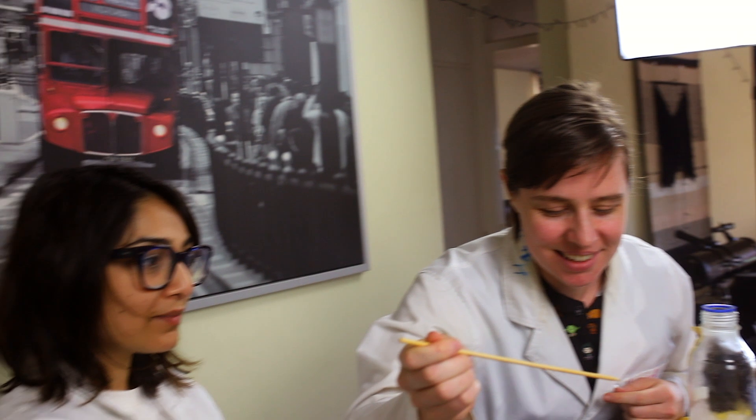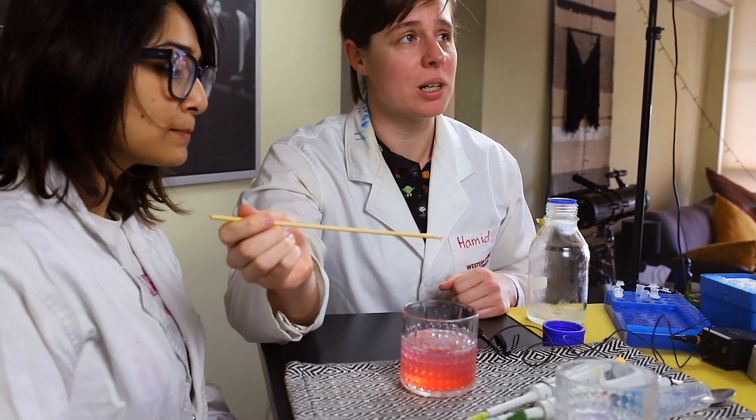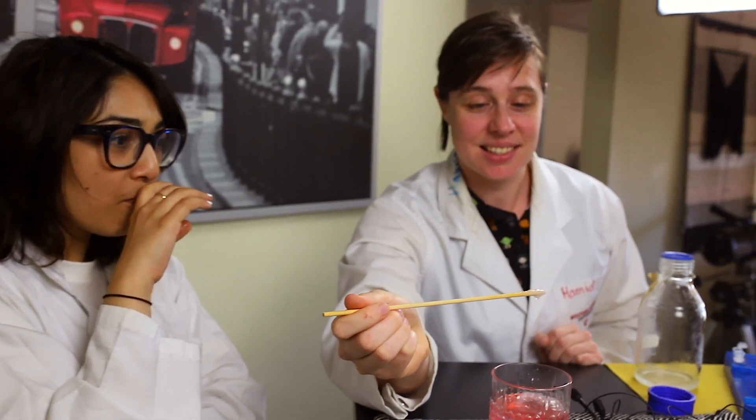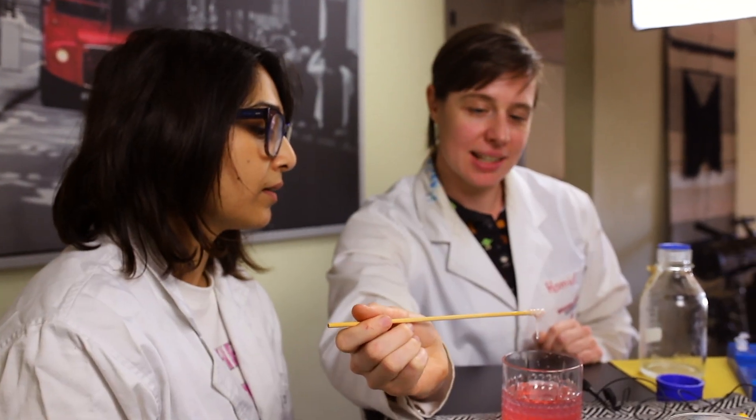So what would you do with this now? Scientists, when they extract the DNA, can then perform analysis. DNA extracted. How do you guys feel having done some science? I feel fulfilled. I feel like the purpose of my life is just — I've been wasting all of my time at university. This is what we need to be doing. I feel like being a scientist means wasting perfectly good strawberries and playing with snot. You're working with DNA. We're getting a lot now. It's starting to rise to the top. From one strawberry — that's a fair bit. I thought we would see the double helix structure of DNA, but we're not seeing that. It's a bit too snot.